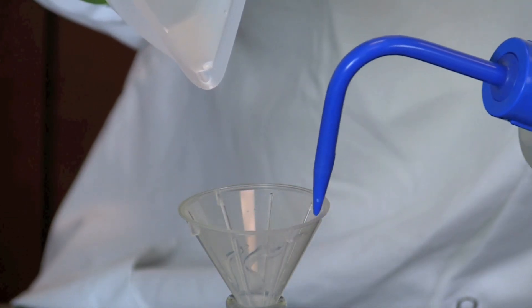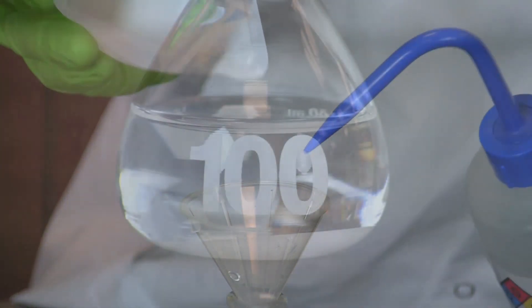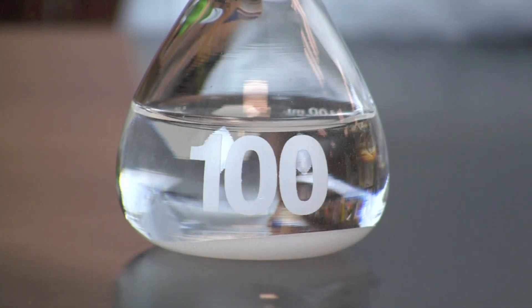Also rinse the contents of the funnel into the flask. Fill the flask approximately half full with distilled water.